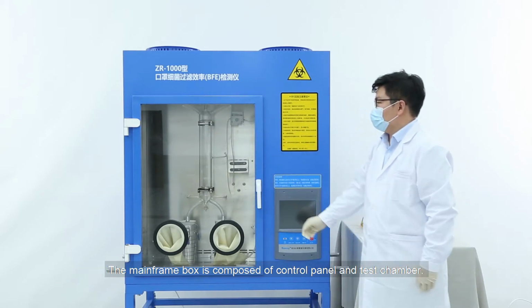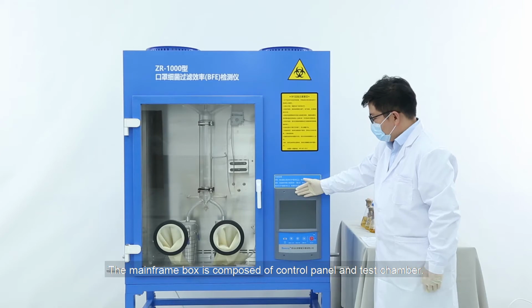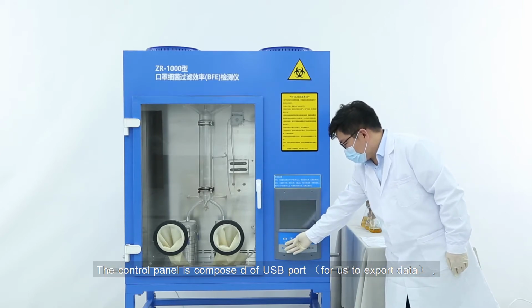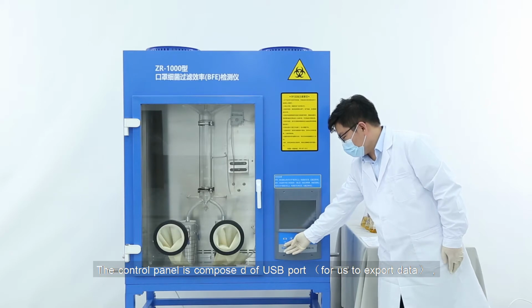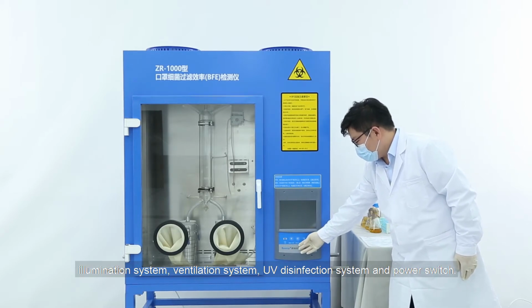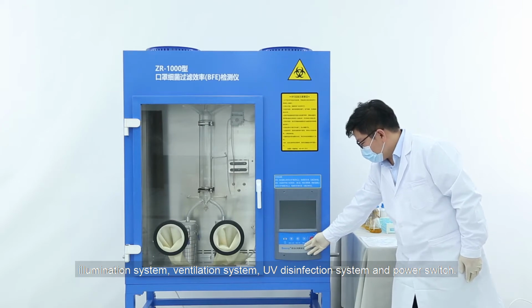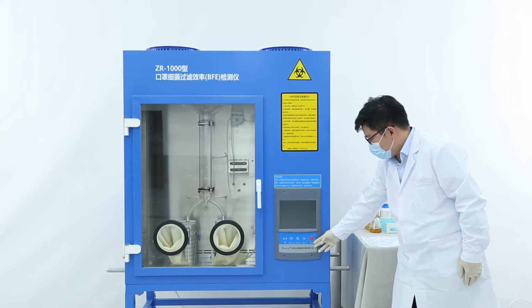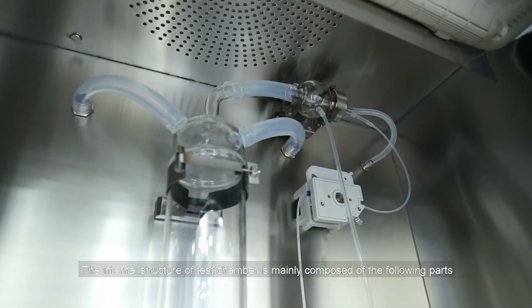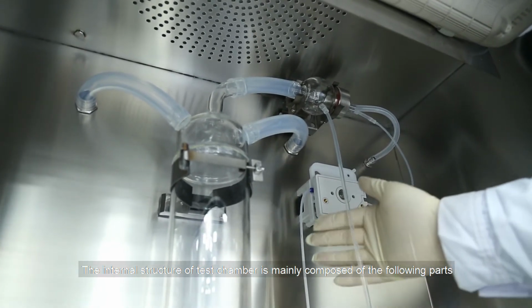The mainframe box is composed of the control panel and test chamber. The control panel is composed of a USB port for us to export data, illumination system, ventilation system, UV disinfection system, and power switch. The internal structure of the test chamber is mainly composed of the following parts.